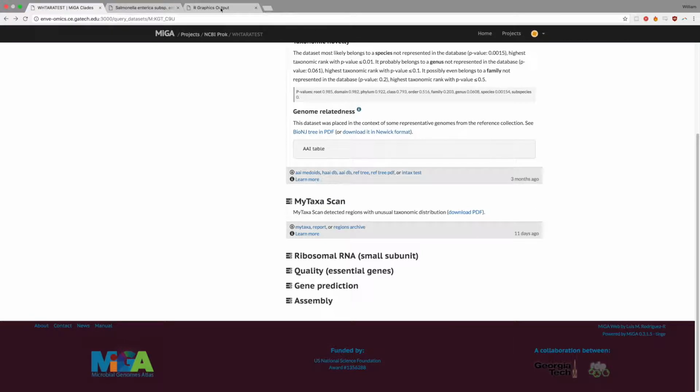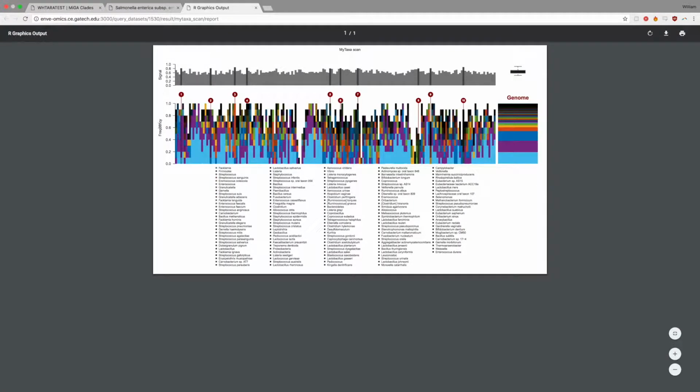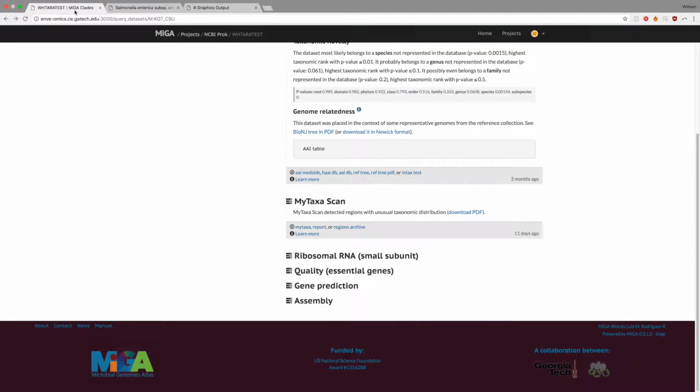MyTaxa Scan basically scans the whole input genome in windows of 10 genes and determines the likely phylogenetic origin of each window. Subsequently, MyTaxa then flags windows that deviate significantly from the genome average. Thus, MyTaxa Scan is a CPU-intensive task and an optional analysis that a user has to request by checking the corresponding box.